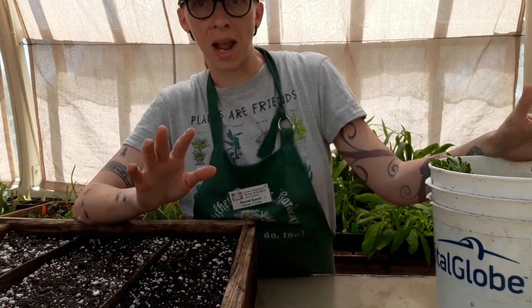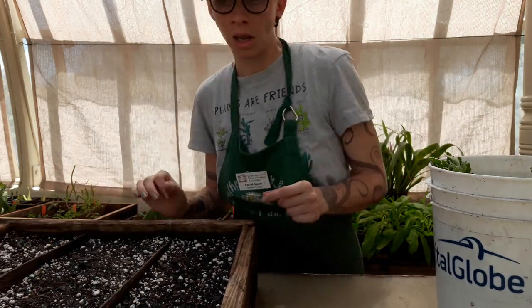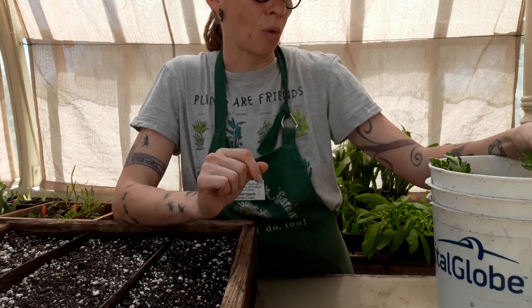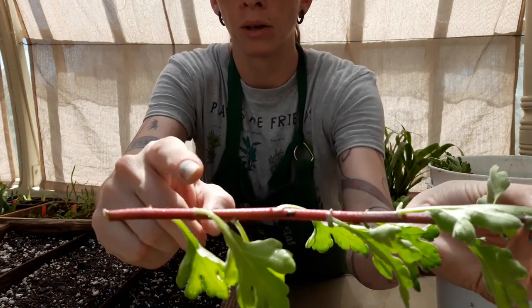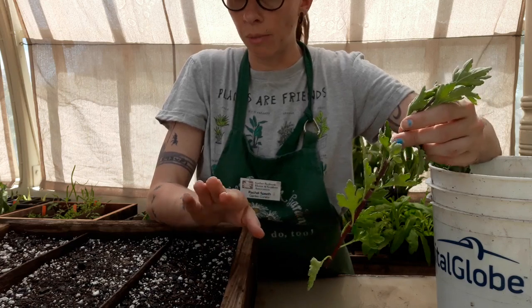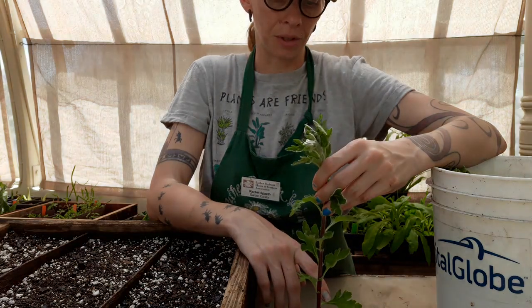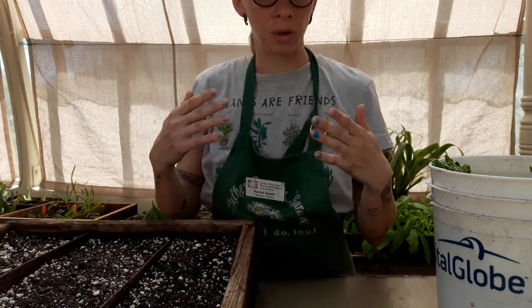So we're going to see what the fine balance is between having leaves and not having leaves. To do this we're going to make cuttings of phytomeres — we want a stem cutting with at least three nodes. Since our experiment treatments are zero, one, and three leaves, we need at least three nodes above the soil and about an equal number below. So we want six-node segments: three underneath the soil and three above the soil.